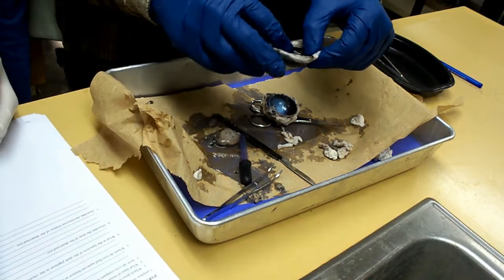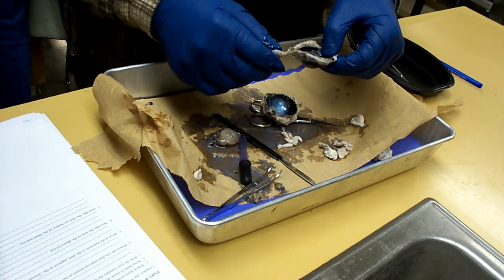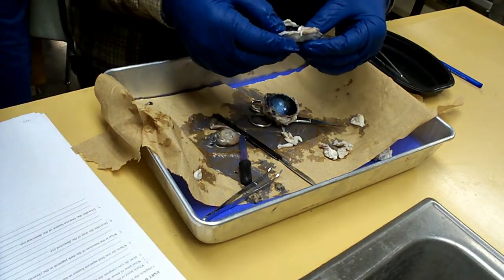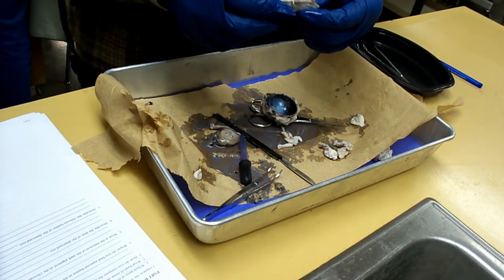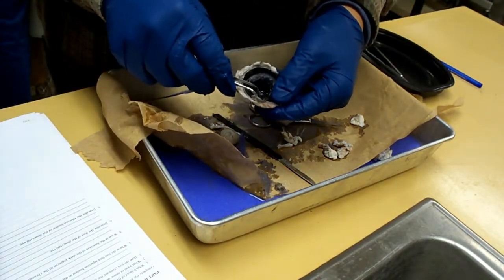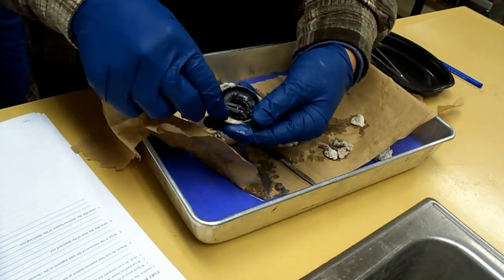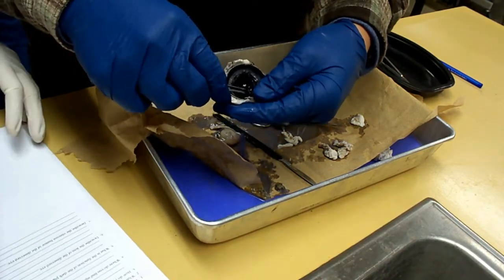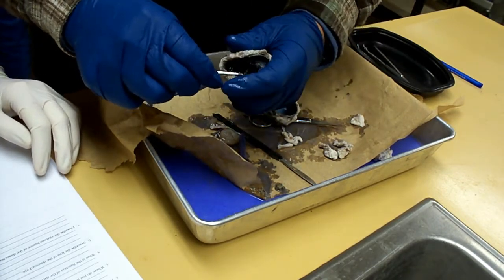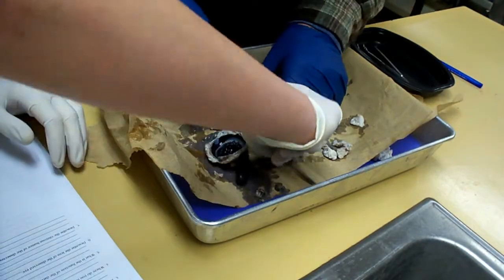Questions on the band sheet. I think that's connected. The first one's sclera. The second one's connecting tissue. Yeah, the second question is connecting tissue because it started with a C. It's sclera and then it's connecting tissue. That's the thing that they talked about. Saying that it's the tapetum. Oh, the shiny part. Yeah, the shiny part. Do we have to take that off? Yes. Check it out. Let's just mutilate it all. It's not complying. Just cut it out.